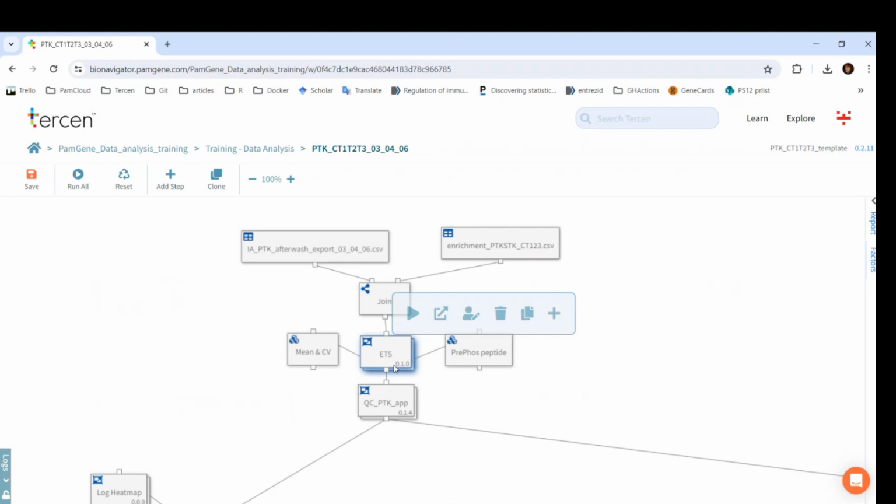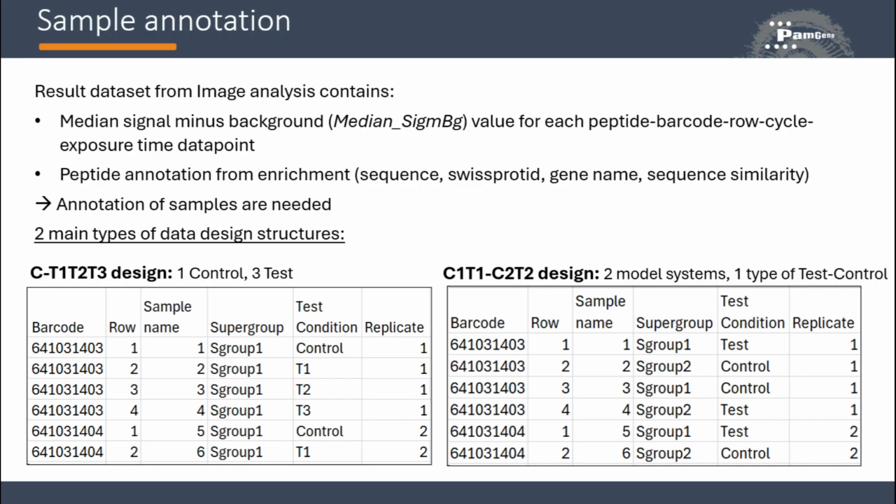Next, there are three steps that concern the quality control of the data: the mean and CV, the prephosphorylated peptide, and the PTK QC. These are the steps that are involved in the first part of basic processing, the quality control. Now, let's take a closer look.